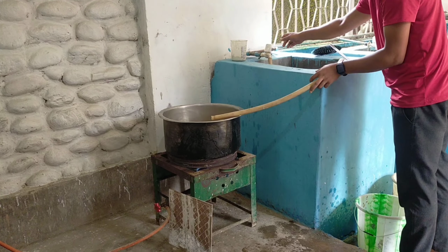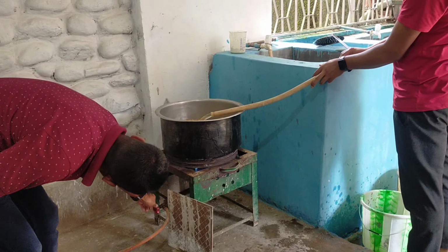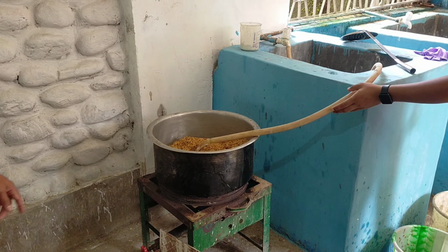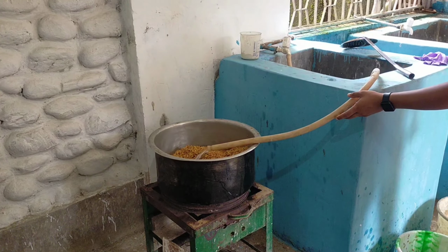Now it's time to add the water. Water should be double the amount of the grain. Like if you're using 1 quintal of dry rice, then add water about 2 quintal. 35 minutes.